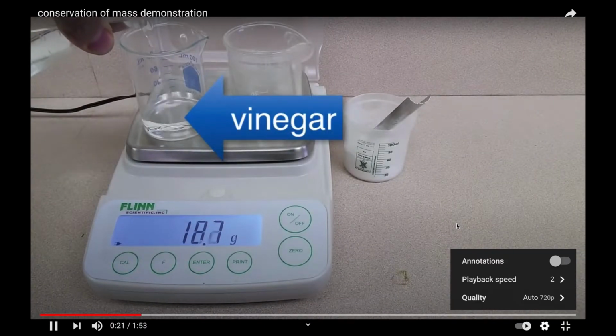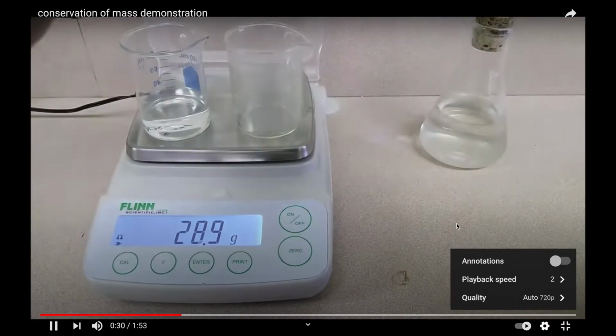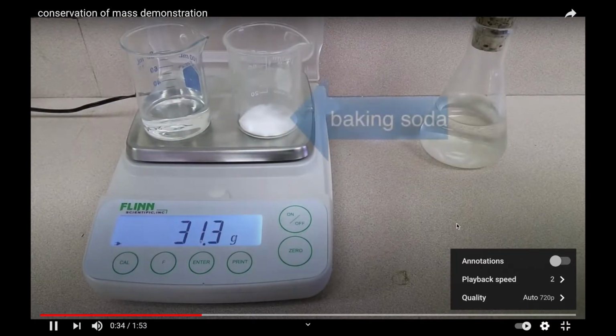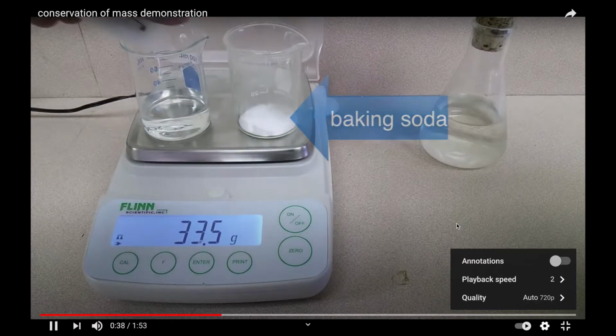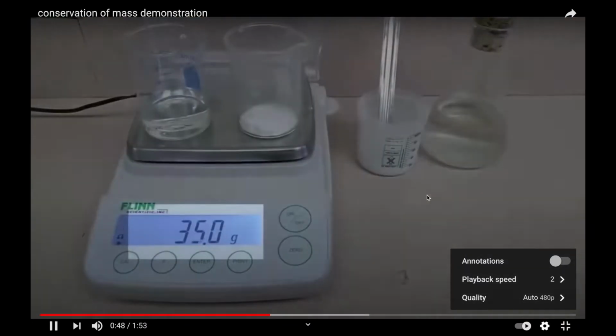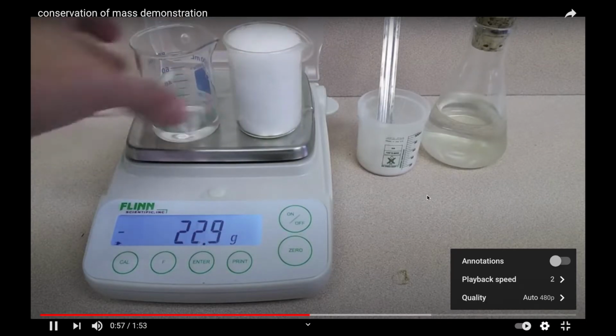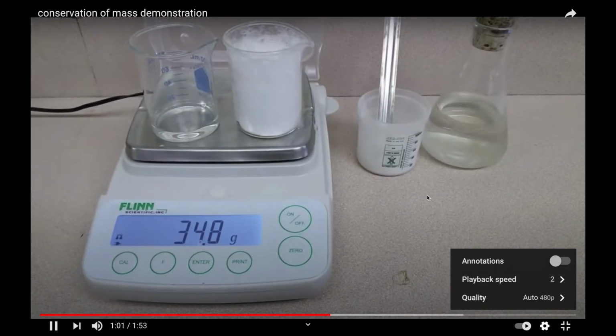And so he is adding vinegar to the left side, and you see it weighs 28.9 grams. I think that's with the beakers. And then he's adding some baking soda. And check it out, it's 35.0 grams. So he does the reaction, vinegar and baking soda. Oh, it spills over. Okay, whatever. But that drop still stayed on the balance, okay?